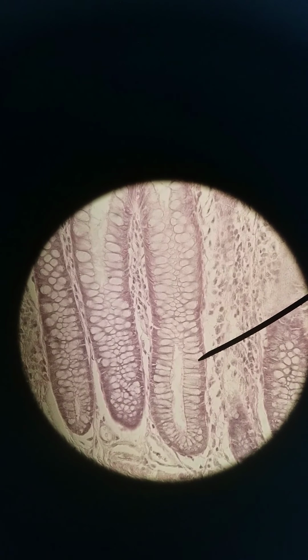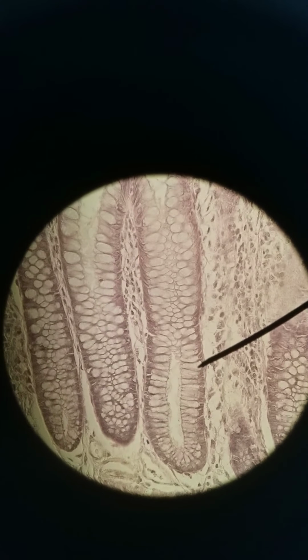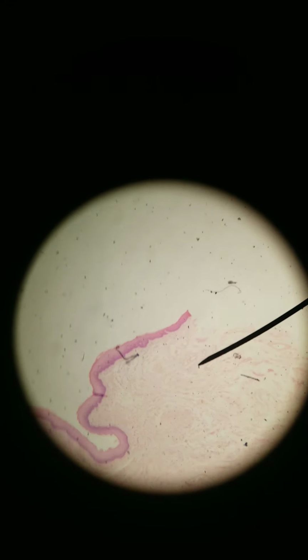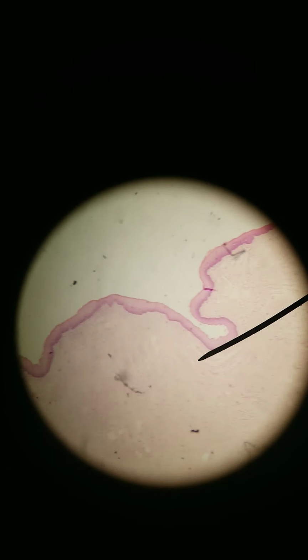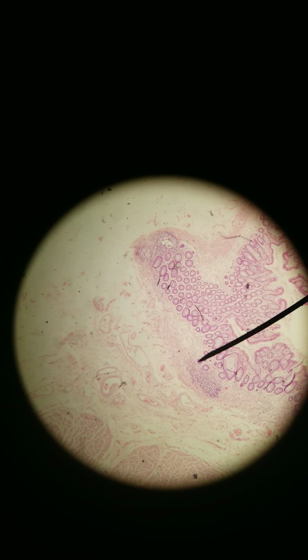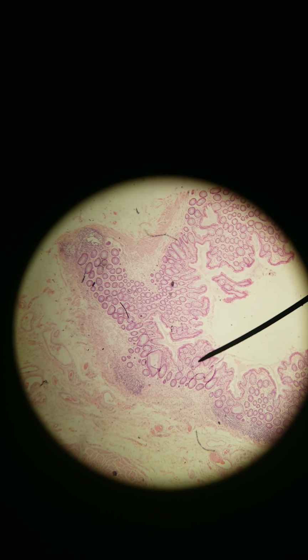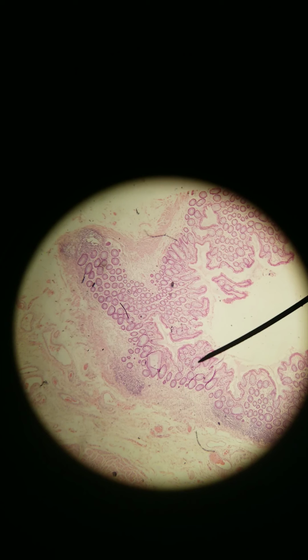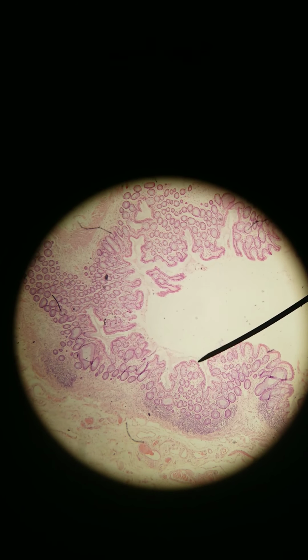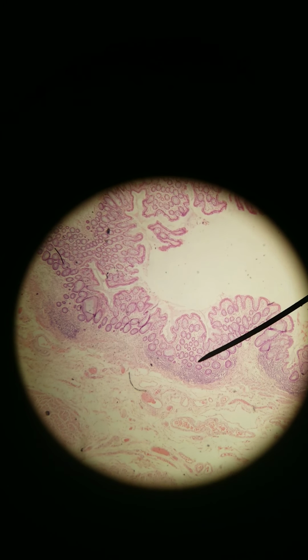Yeah, that is the colon. Most of the large intestines looks like this. We keep going from ascending, transverse, descending, sigmoid colon, and then we get to the rectum. The rectum is also like the large intestines and small intestines in that it's also simple. Starts out simple columnar. So here we see at 40X the groupings of simple columnar cells.